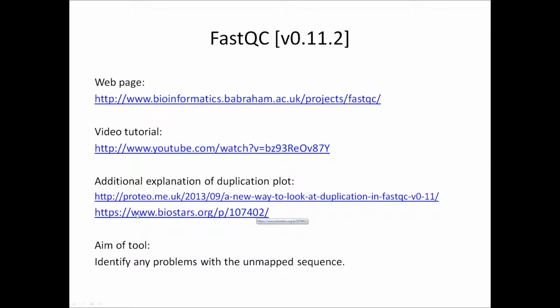So the main aim of this tool is to identify any problems that there might be in the unmapped sequences, and this gives us an idea of whether to use the sequences at all, or whether there's anything we can do to save the sequences to make them usable in the downstream analysis.